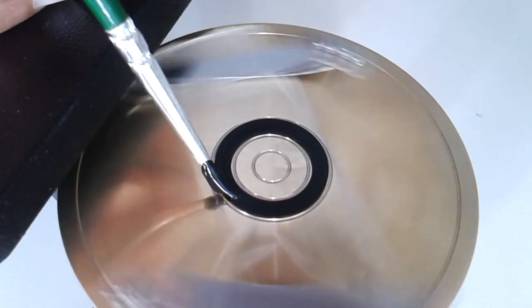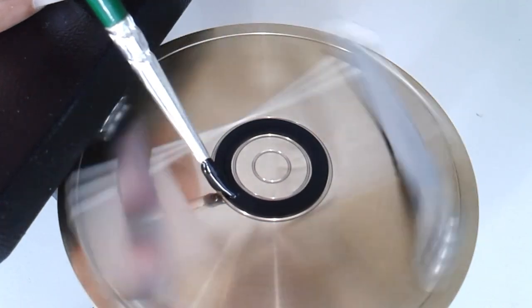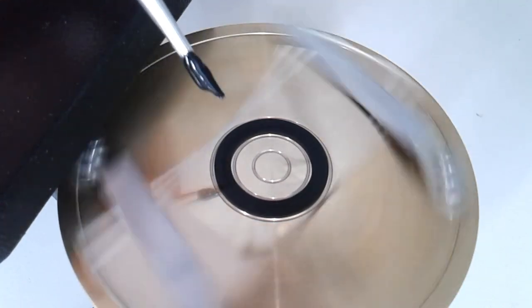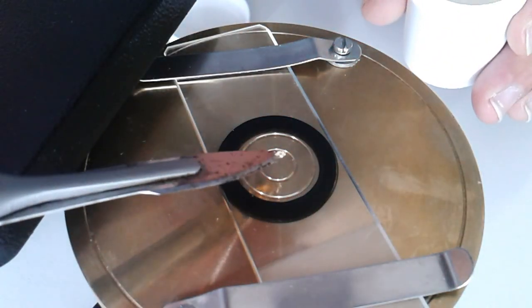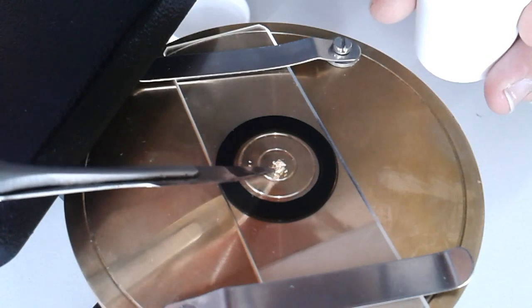Probably a little bit thick, I would say, but it's the first time I'm actually trying this. Maybe with a little bit more practice I can apply thinner rings here.